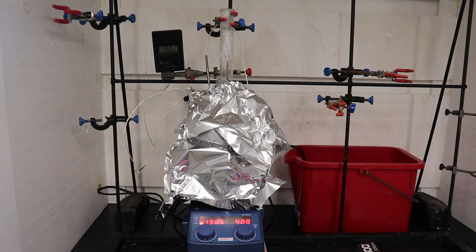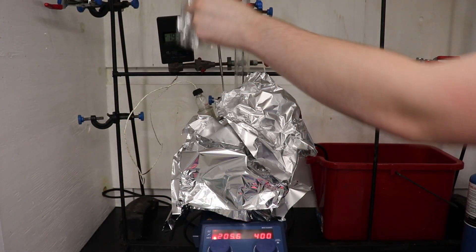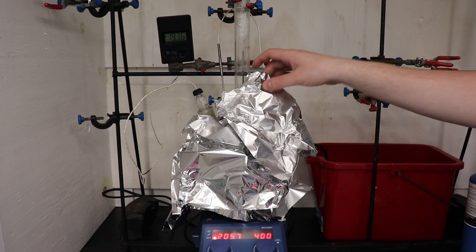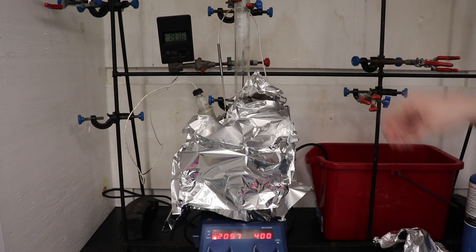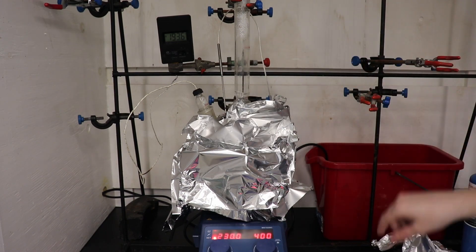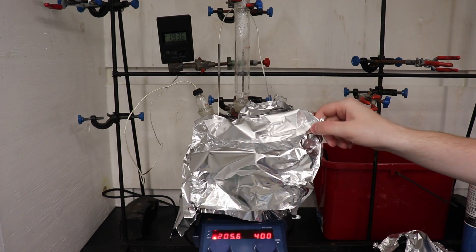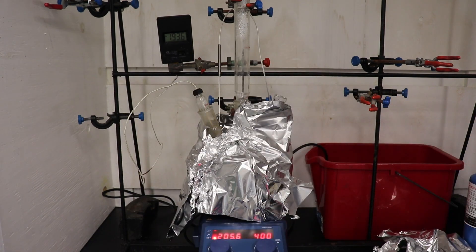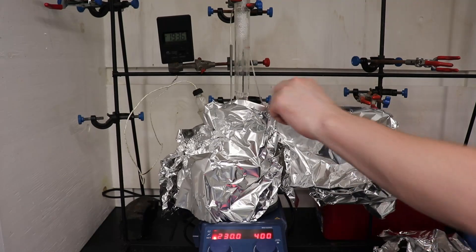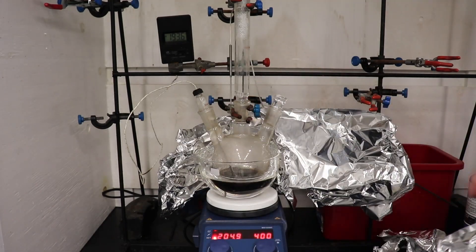During the extended high-power heating time, the hotplate I was using broke, so I had to switch to a lower-power hotplate which was only able to reach a temperature range of 190 to 195 degrees Celsius. This ended up decreasing the total yield by about 10% as compared to a previous run where I was able to maintain the proper temperature range of 200 to 210 degrees Celsius.